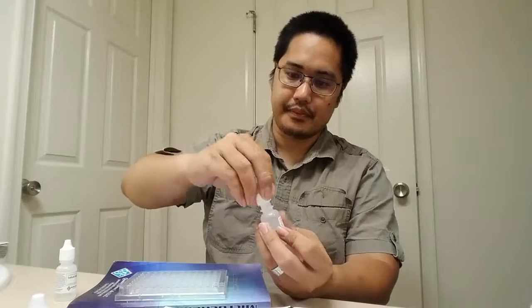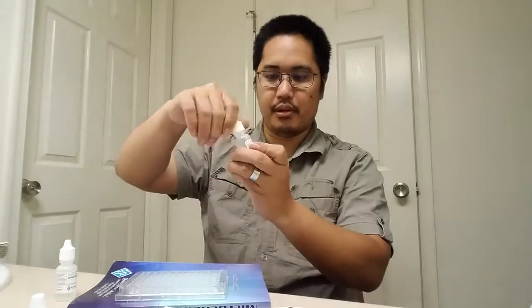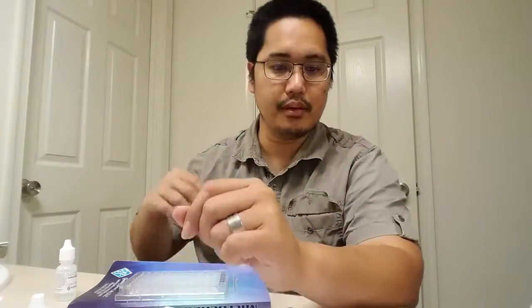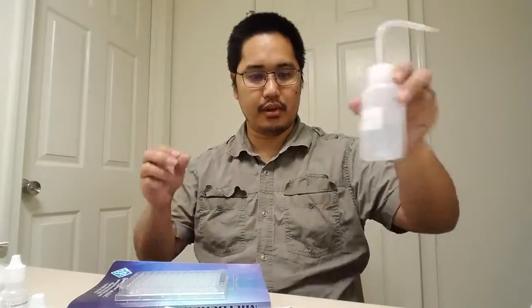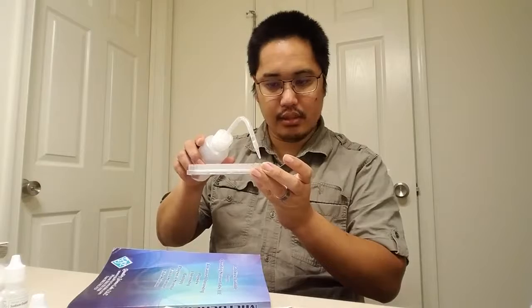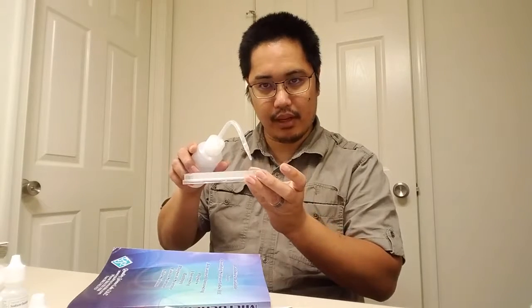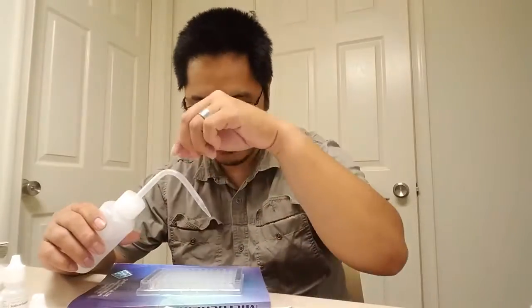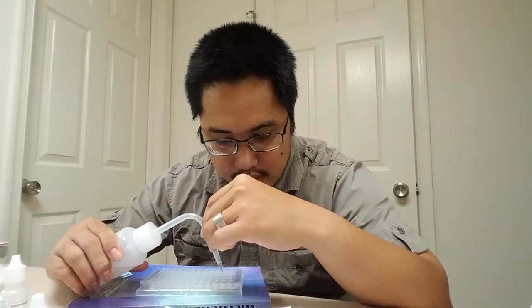All right. Now, the molarity of this calcium nitrate, you can see right there, says 0.1 molarity, so 0.1 moles per liter. We're also going to take distilled water and put 4 drops in wells A2 through A7. So I'm going to skip well A1 and go A2, 3, 4, 5, 6, 7. I'm going to put 4 of these drops into each. 1, 2, 3, 4.